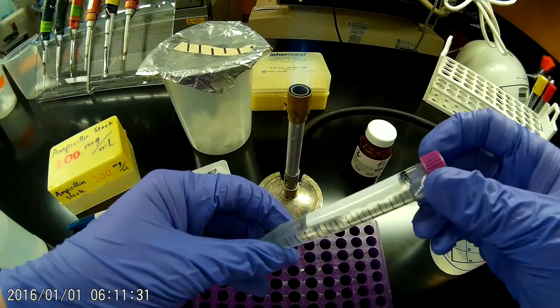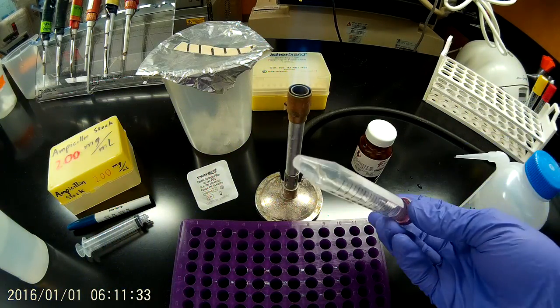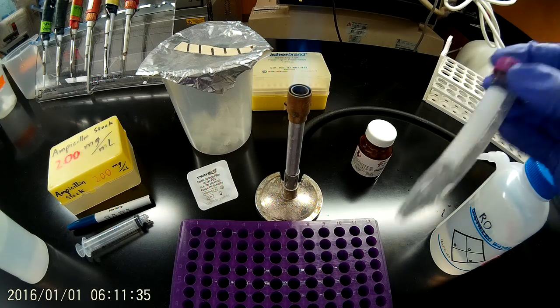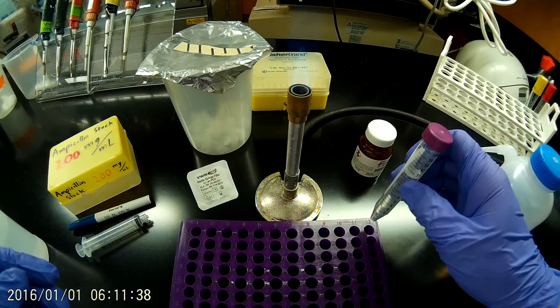Again, I'll rock that back and forth a couple times just to make sure that it's completely homogenized. Okay, so I'll set that aside.